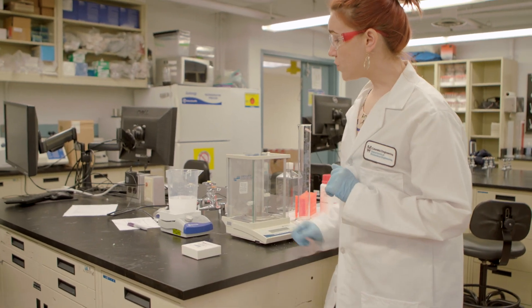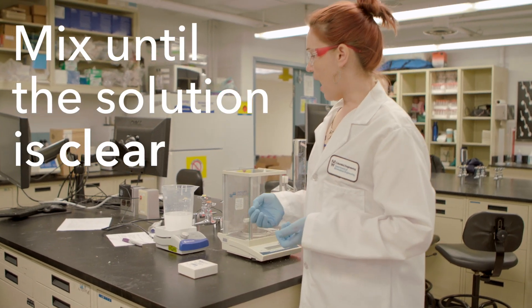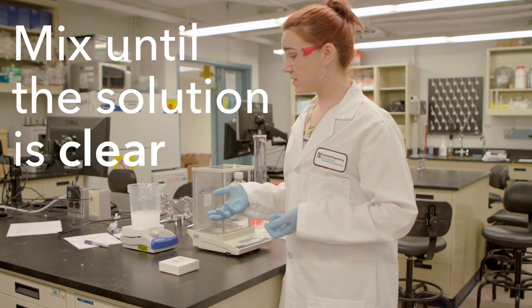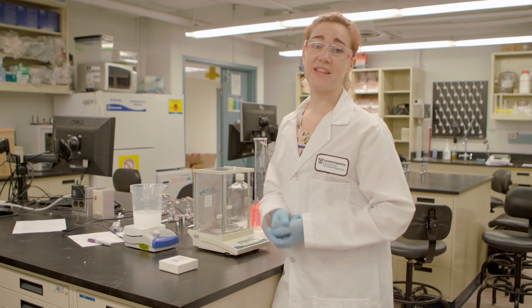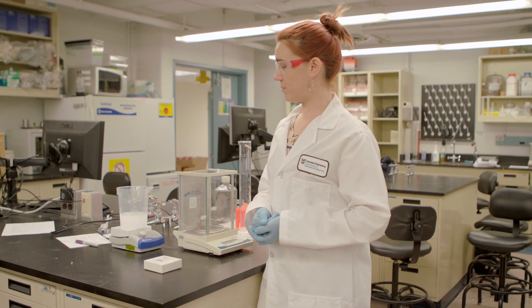So now I'm just waiting until the solution goes clear and my salts have fully dissolved. Then I'll take the final volume up to 500 mils.